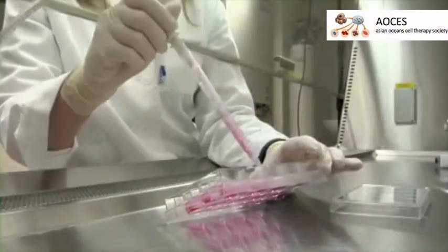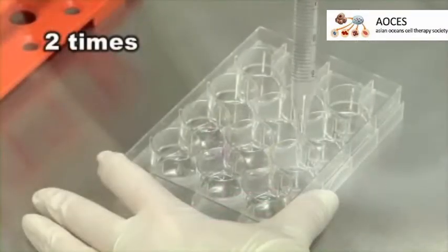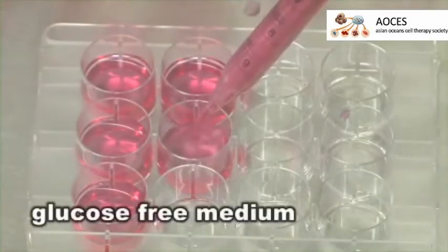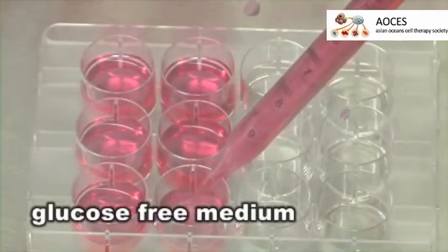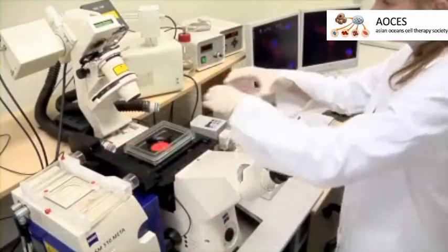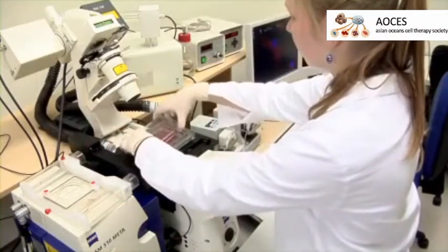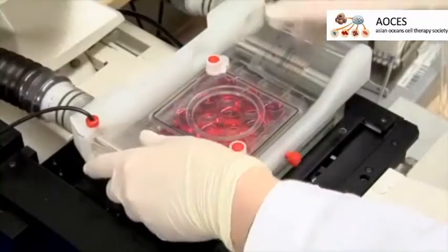Remove medium by aspiration. Wash cells twice with PBS. Add 3 ml glucose-free medium. Place the plate into the cell incubation system. Start nitrogen gas to purge the oxygen out of the incubation system.